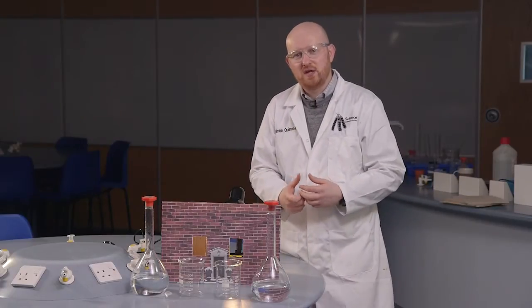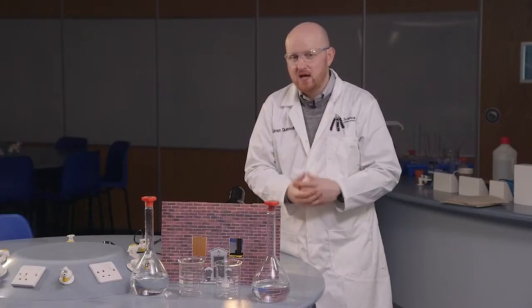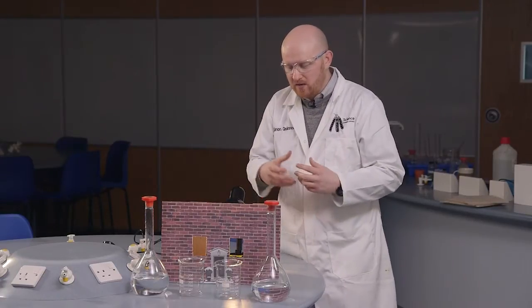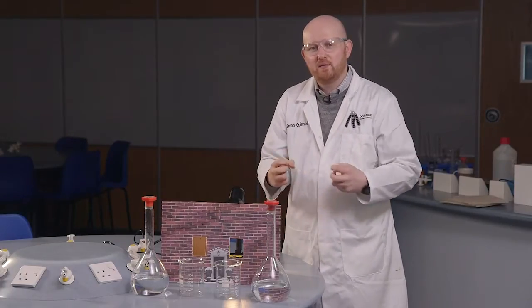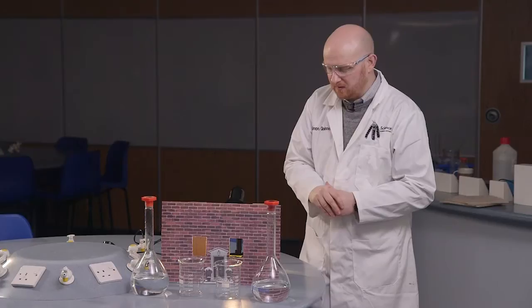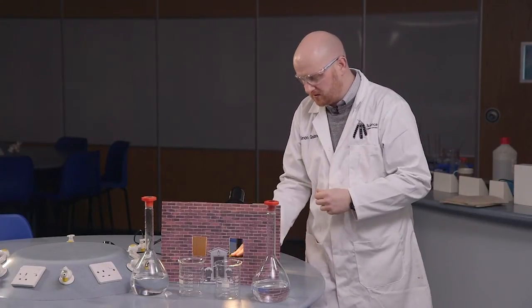The whole idea of this demonstration and to link it into our Christmas theme and Santa Claus coming to deliver our presents is that we're going to use the iodine clock to turn the lights off for us. So a nice bit of chemistry just showing this nice principle.